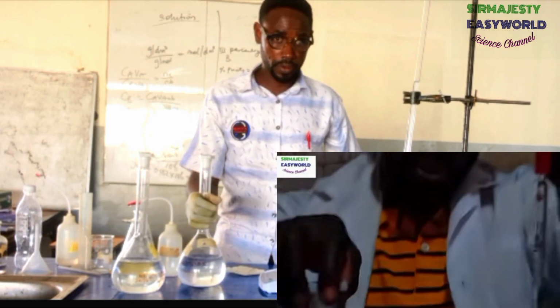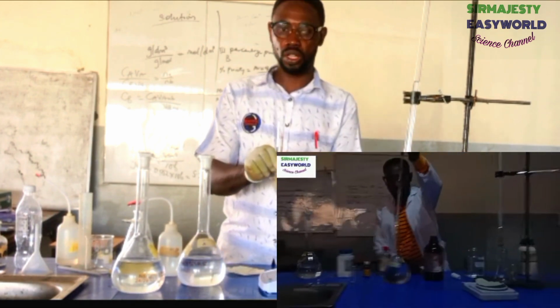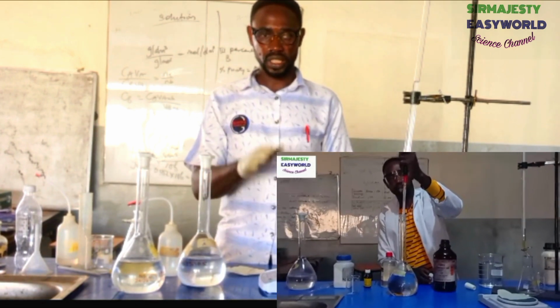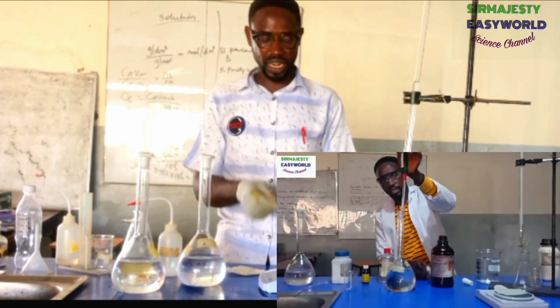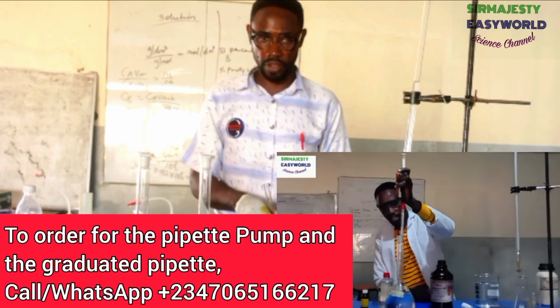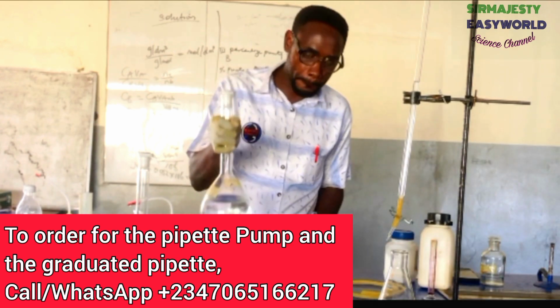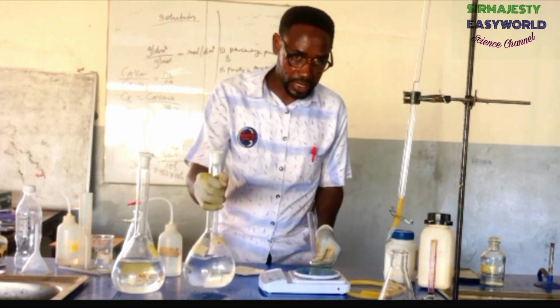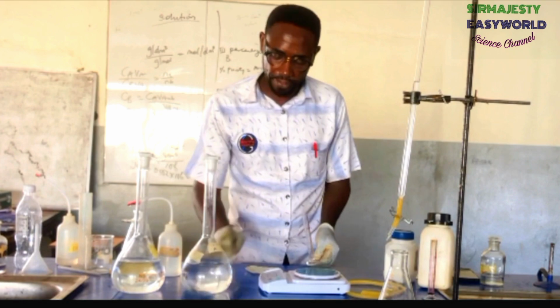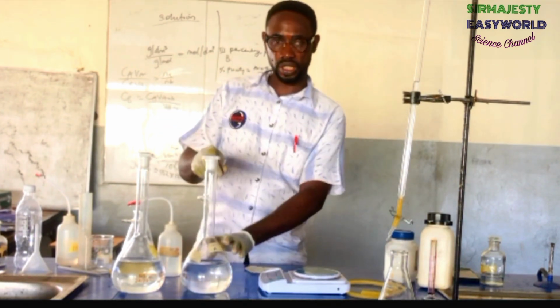I repeat, in solution A, you are required to measure 6.30 cm cube, meaning use this small 10 ml graduated cylinder, or you can use the graduated pipette with the pipette pump. You can see it on the screen and measure exactly 6.3. It's more accurate with that pipette pump, which if you want, you can order for your own. It makes the work easier. You measure 6.3, then bring 1000 ml volumetric flask, and then do what? Add some water. Don't just maybe half, and then gently do what? Add the 6.30 into the thing.